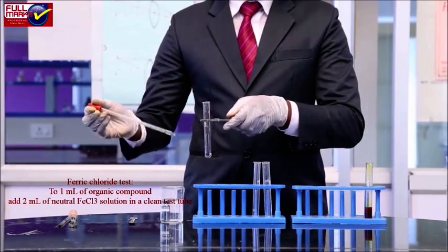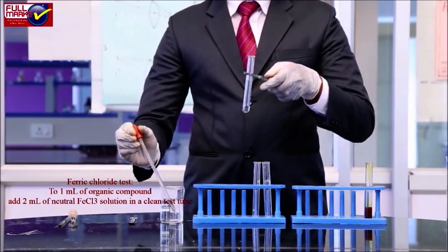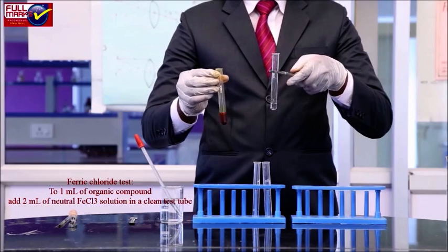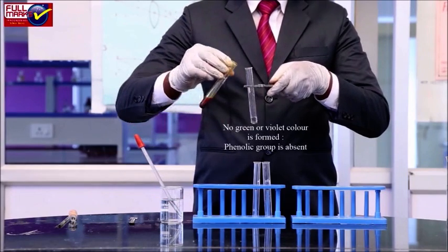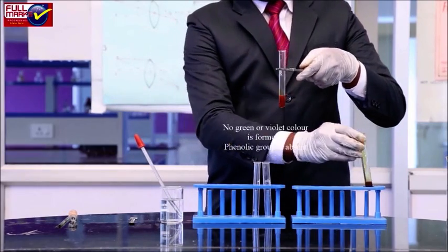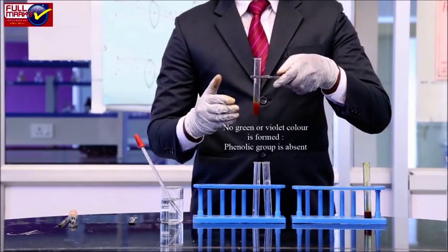Ferric chloride test. To 1 ml of organic compound, add 2 ml of neutral FeCl3 solution in a clean test tube. We observe that no green or violet color is formed. So, phenolic group is absent here.